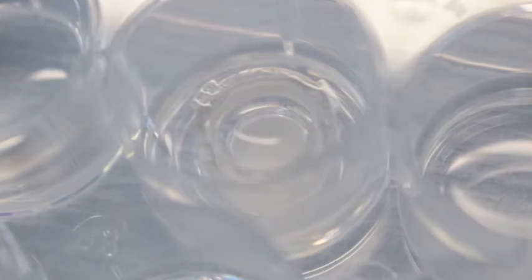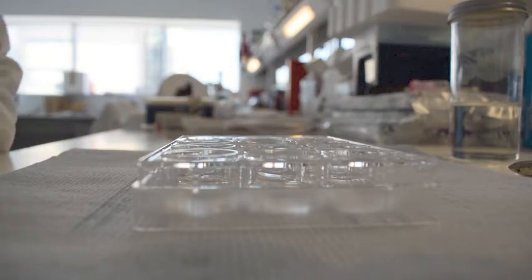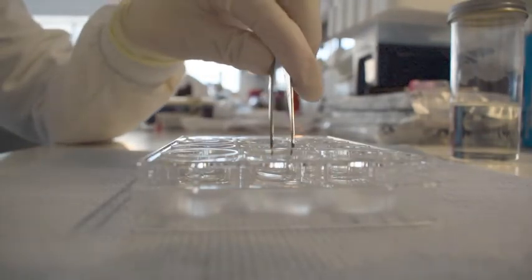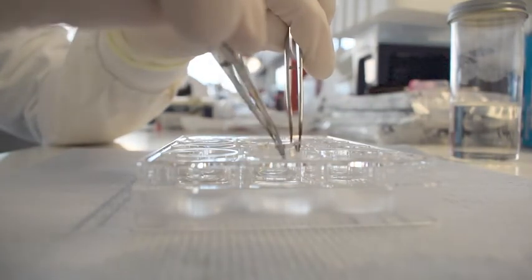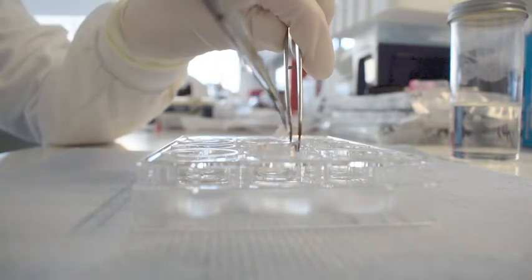Tissues are then transferred to trypsin EDTA for 15 minutes to individualize cells. Following incubation in trypsin EDTA, the stratum corneum is removed from the tissue cup using forceps.